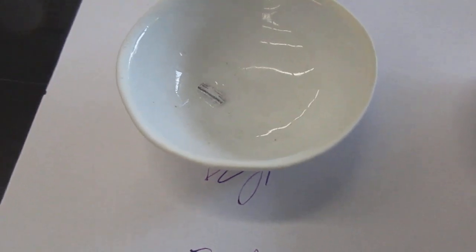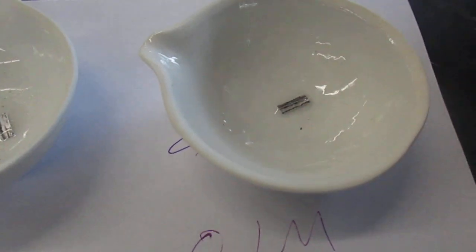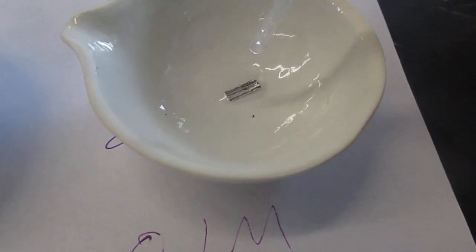There are a few little vapors coming off. Again, I'm going to do that one more time. Just one drop each again. One.